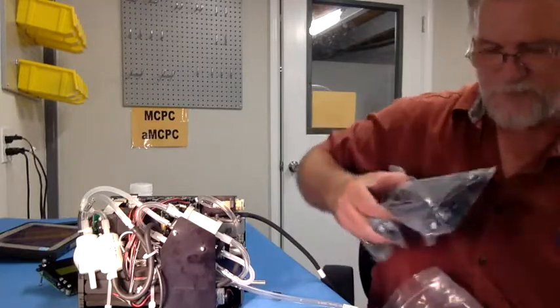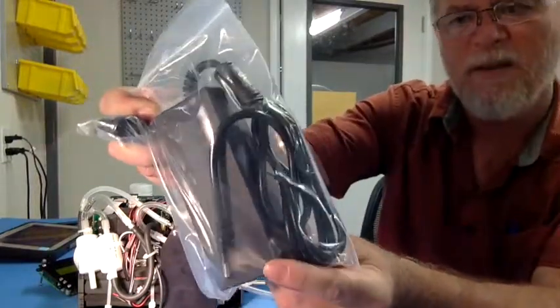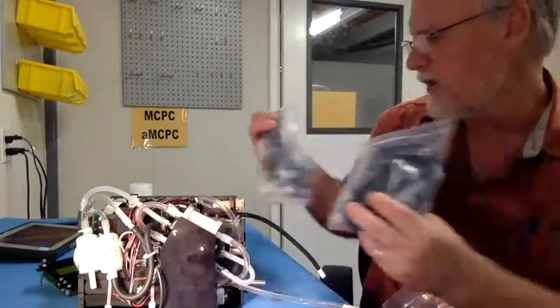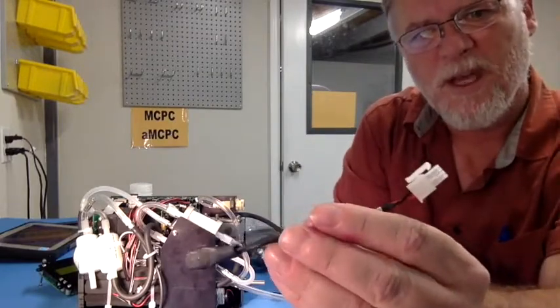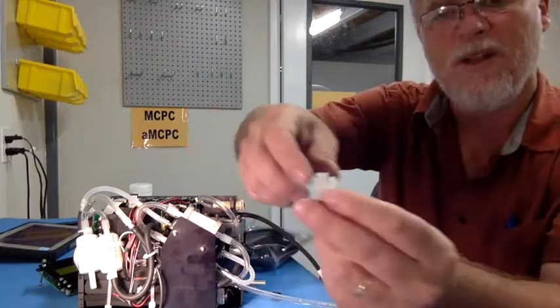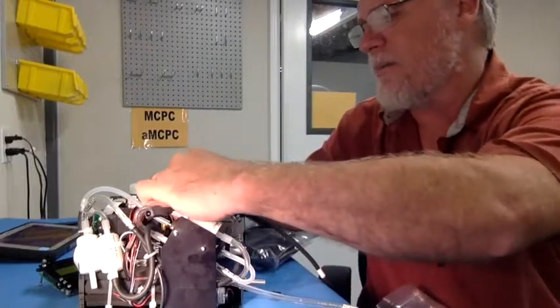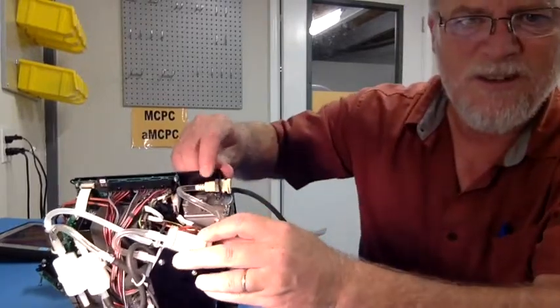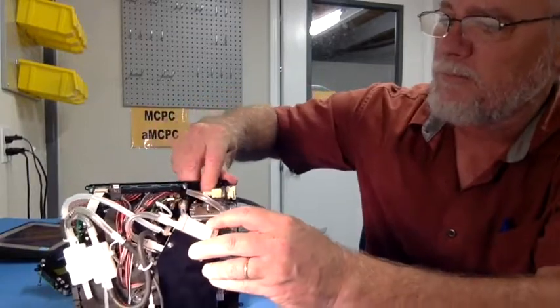which is here, this power supply is just a standard AC/DC power supply. It comes with the AC power cable that is for your country. That will plug into this power connector, okay, which is also supplied with the unit. So to connect that, you see the tab here, all right? That has to lock into the tab that's on the board. So just push it in. You can see now I've mounted it inside here, okay?